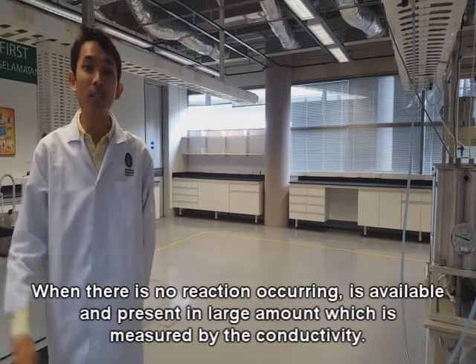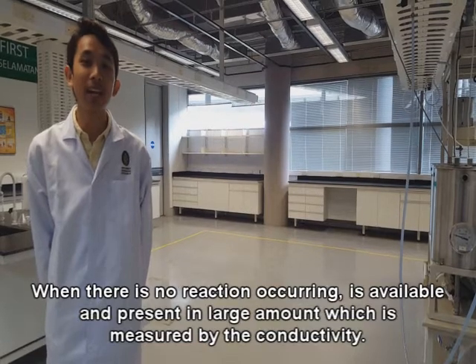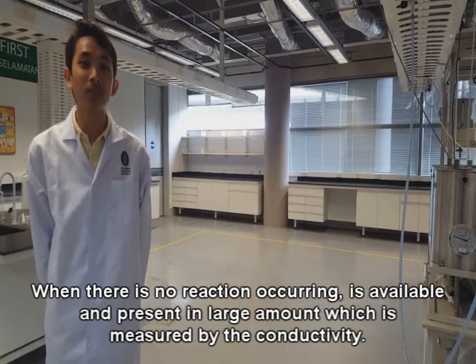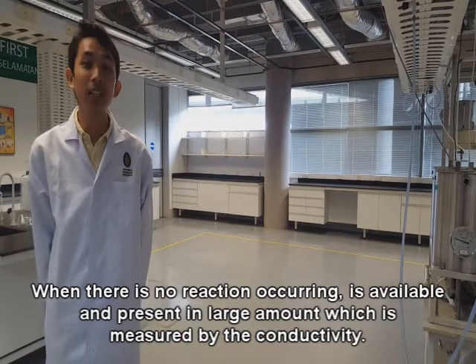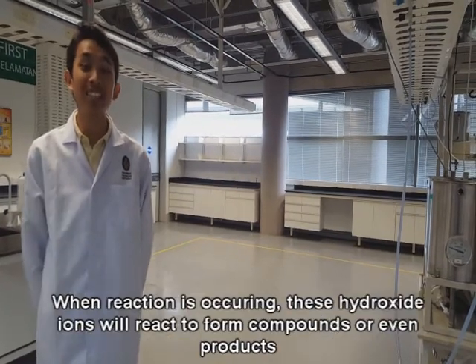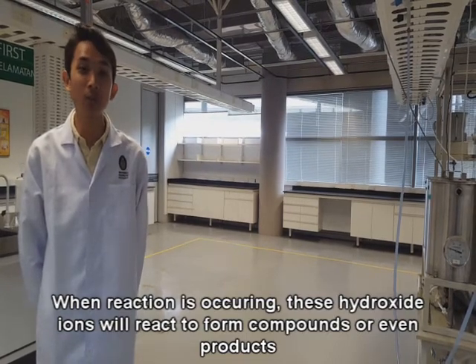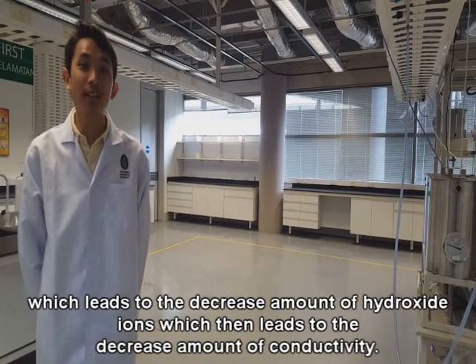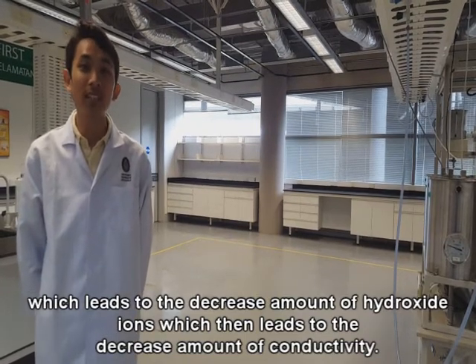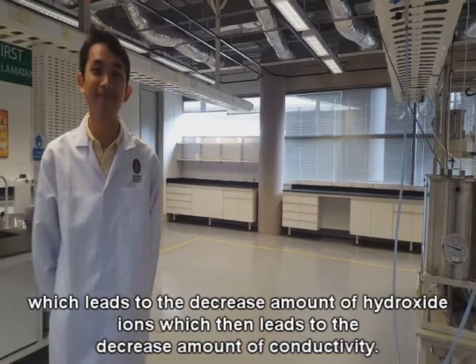When there is no reaction occurring, the hydroxide ion is available and present in large amount, which is measured by the conductivity. When reaction is occurring, these hydroxide ions will react to form compounds or even products, which leads to the decreased amount of hydroxide ion, which then leads to the decreased amount of conductivity.